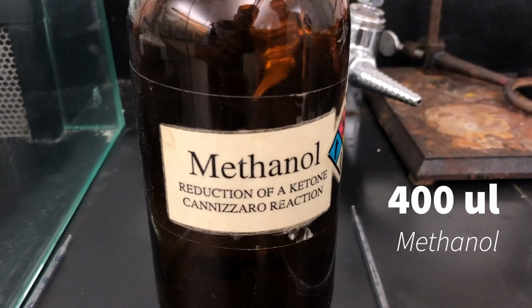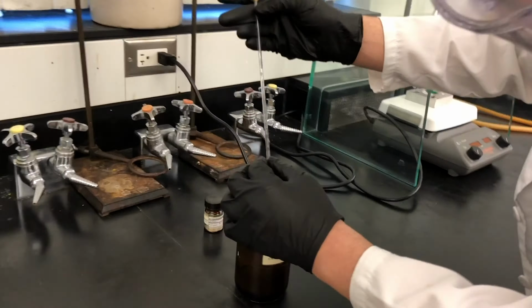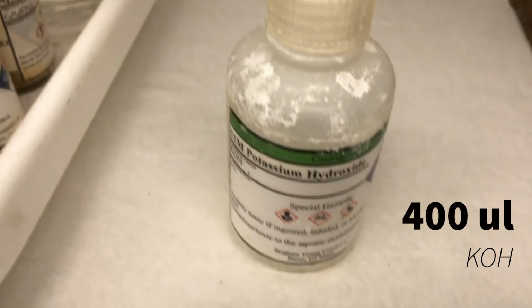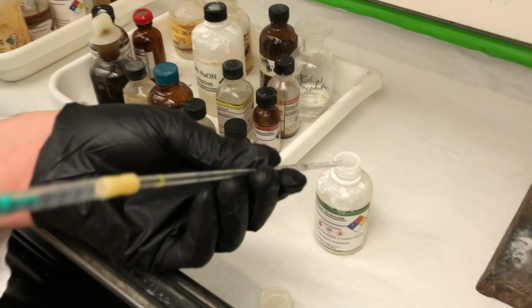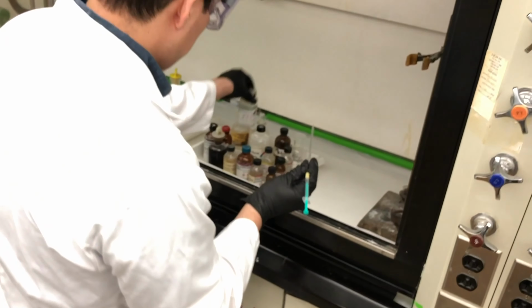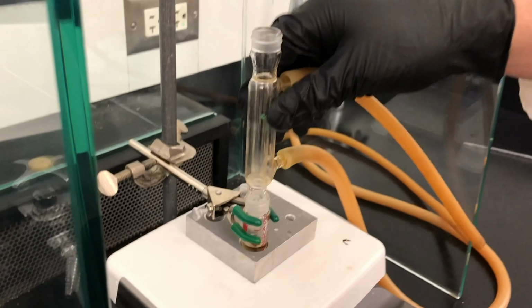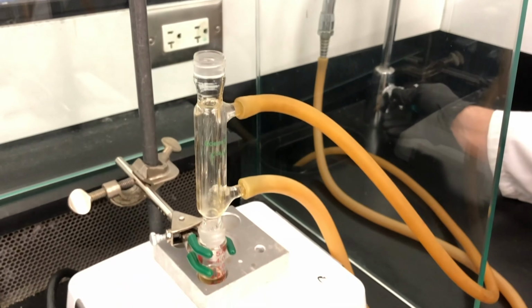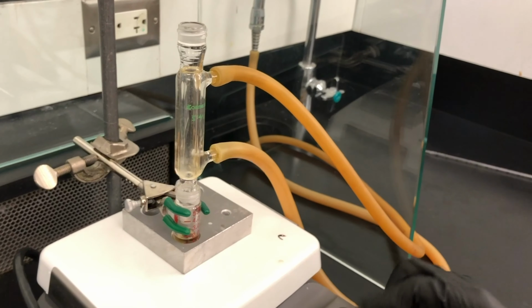Now we'll add 400 microliters of methanol to the conical vial. And 400 microliters of 11 molar potassium hydroxide. We want to make sure to keep this bottle in the ventilation hood at all times. The potassium hydroxide is then added into the conical vial. The water source for the water condenser is then turned on slightly. The reaction mixture is heated and stirred at reflux for 1 hour.